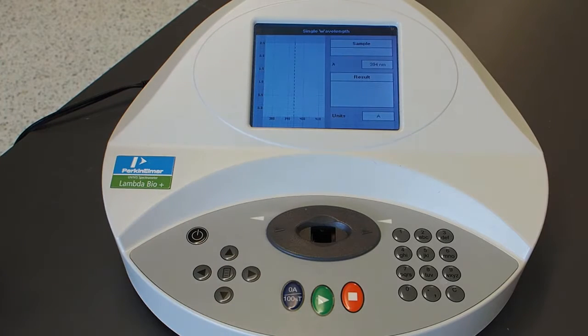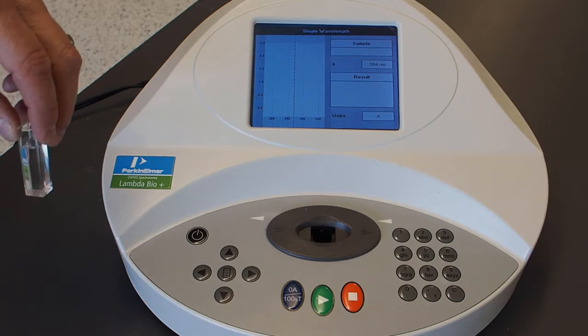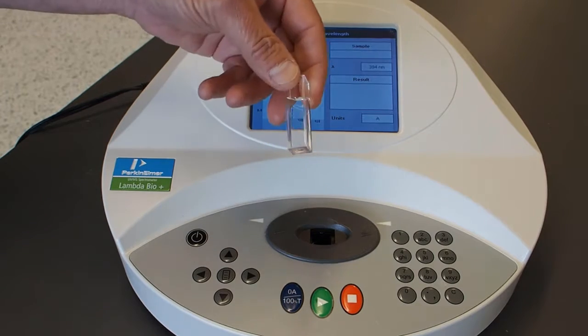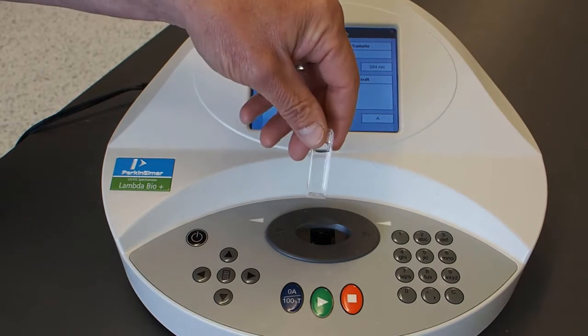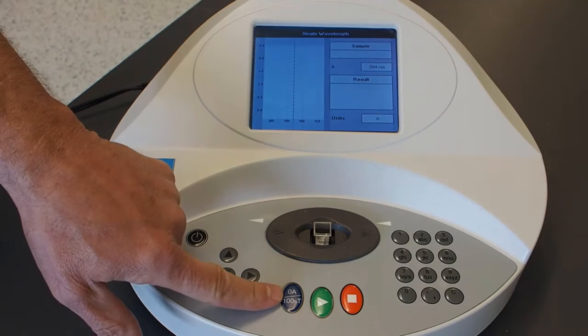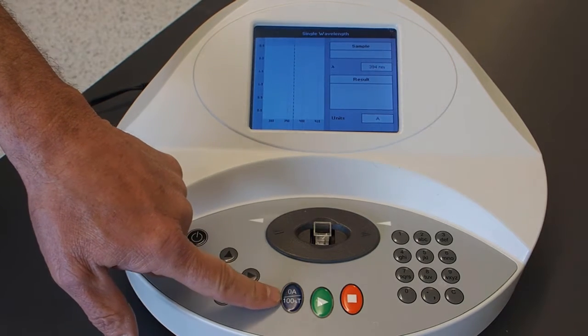Push that. Before we can measure our samples, we need to tell the spectrometer what the energy going to the detector is with no nickel in our sample. To do that, we use something called a blank. It's a solution that has everything in it except the compound you care about. So now we're going to do just water. Normally a blank is the same kind of cuvette, maybe the same cuvette, and the solvent that you're using. We'll put that in the cell holder and push this button here, which means 0 absorbance, 100% transmittance, which means that's the sample that has nothing absorbing at the wavelength that you care about.